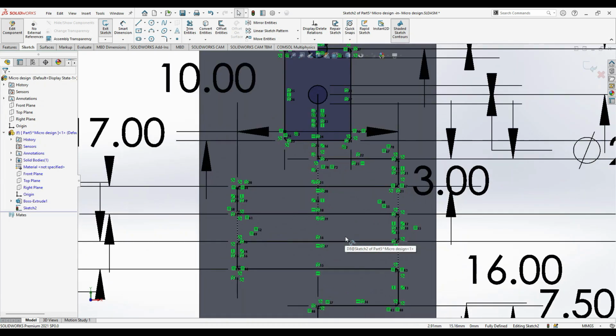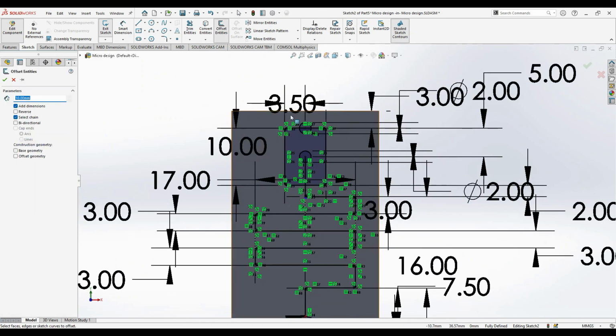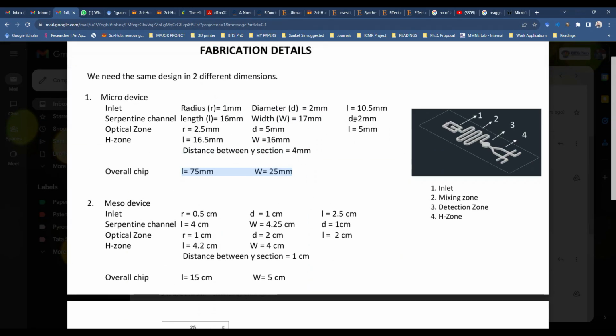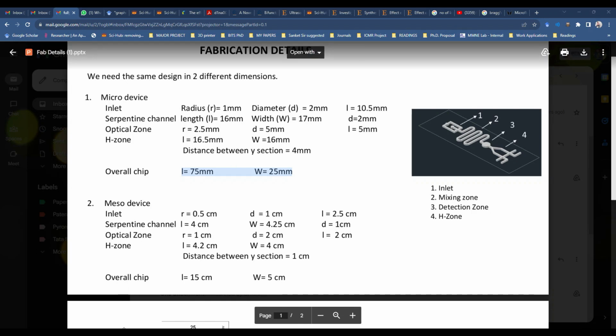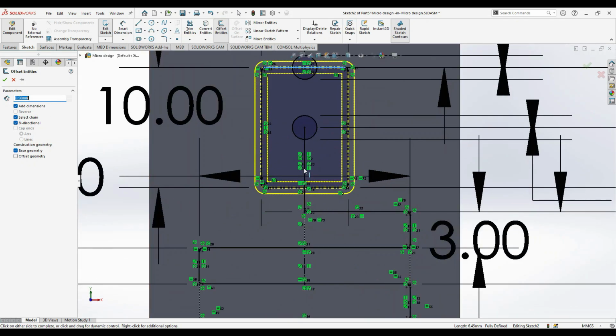And now let's try to create our microfluidic channels. Just by creating an offset, press offset, and we want a channel of 1 mm. Let's see, the channel width is 2. So it is 2 mm, and for that we'll add 1 mm, but you can do a bidirectional. So bidirectional, it means 1 mm on both sides, and then create the base geometry as a construction line. And you just select lines, so you see, so I think it should be 0.5 mm. Yeah, 0.5 mm, and then just select the lines.